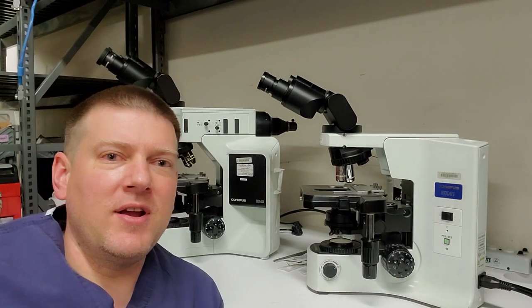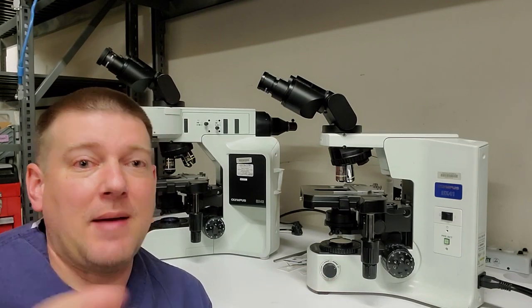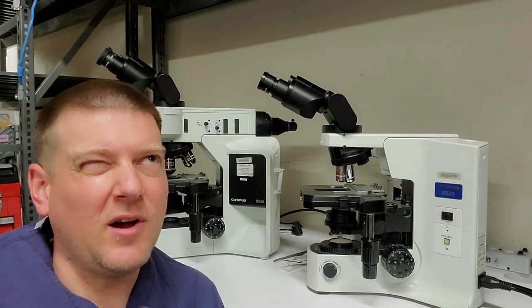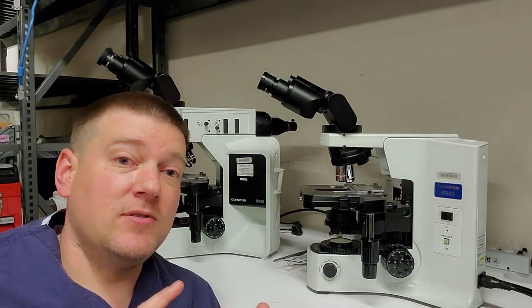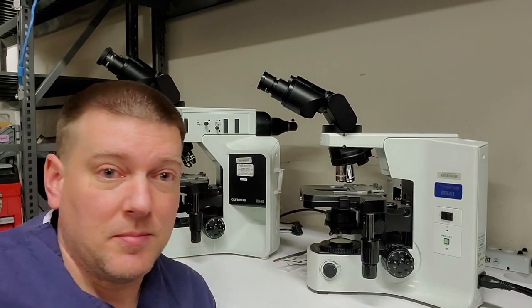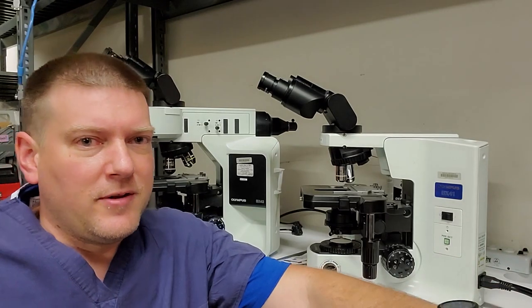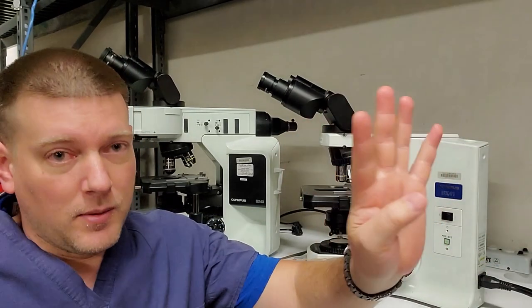Today, I want to introduce you guys to microscopes. Not surgical microscopes, but laboratory microscopes. Now, there are four main types of microscopes. There is bright field, there's dark field microscopes, there's phase contrast microscopes, and there's fluorescence microscopes. That's the main categories. I'm sure that there's some other variants that are very special and very expensive. However, there's four main types.